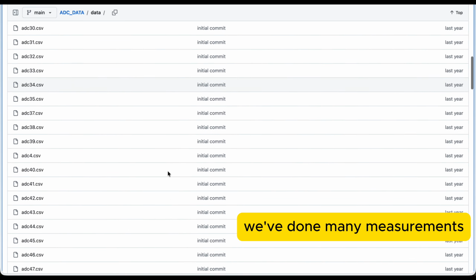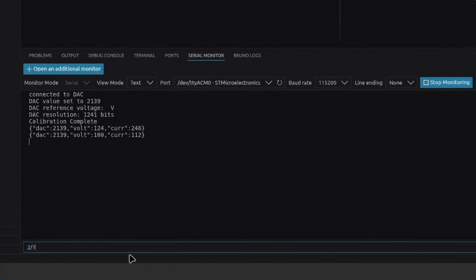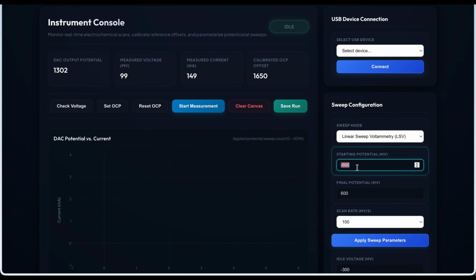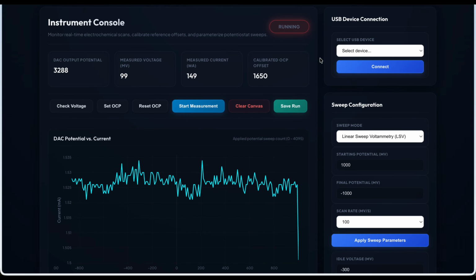But when we have to do this for every measurement, it's cumbersome. Not to mention, we have to give the device commands and we need to remember the device parameters, which are important. Therefore, we made a web app that can communicate with the device better than this approach.